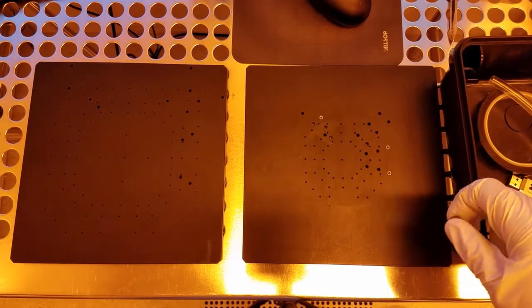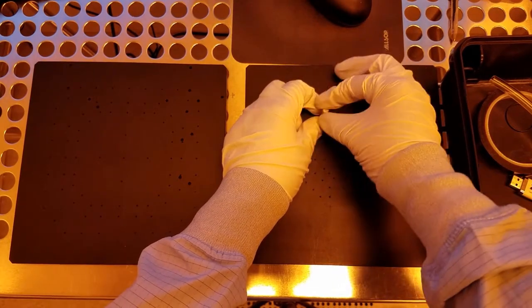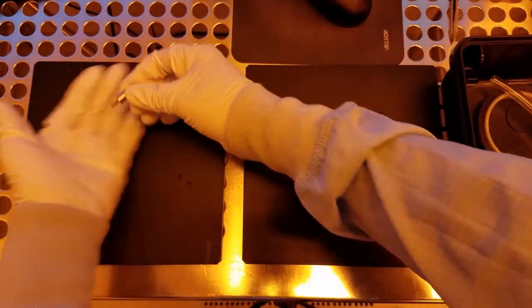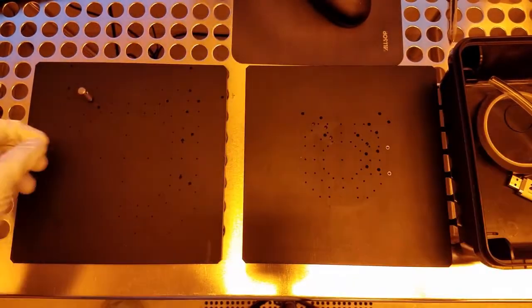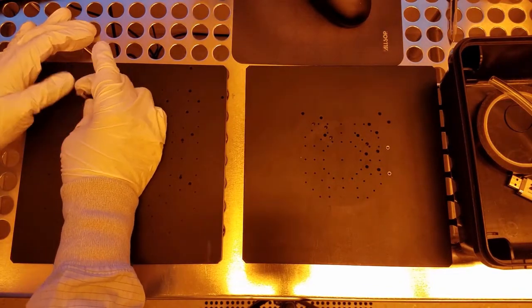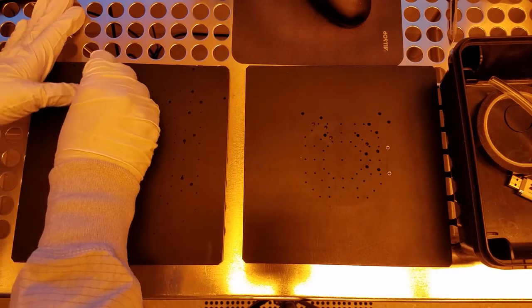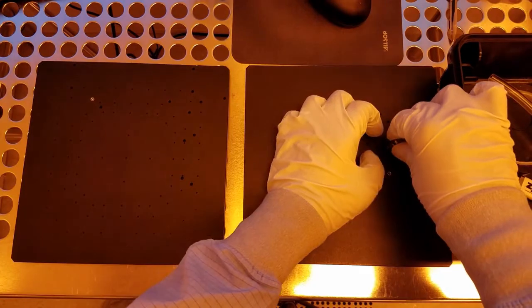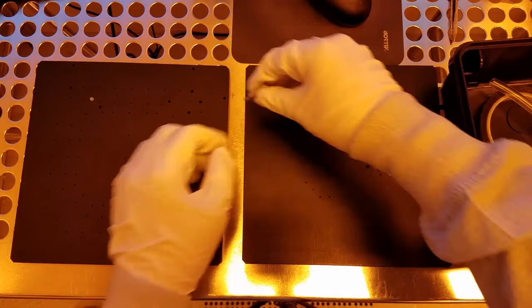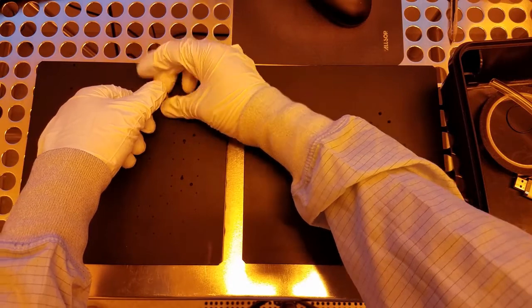To change a pin, take this tool and screw it into the pin. The pins are threaded on the inside. Carefully guide it to the desired chuck, place it in the hole and unscrew it. Repeat this for the other pins. You don't have to screw the tool in all the way — just enough to grab the pin. I usually screw it in about 3 or 4 turns.